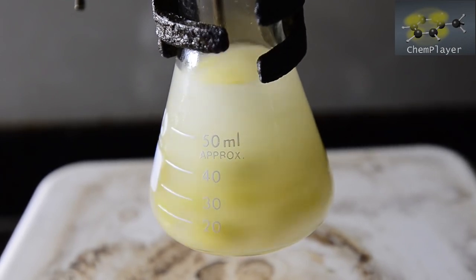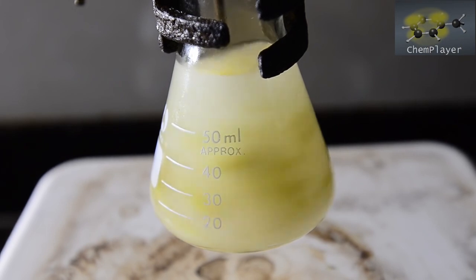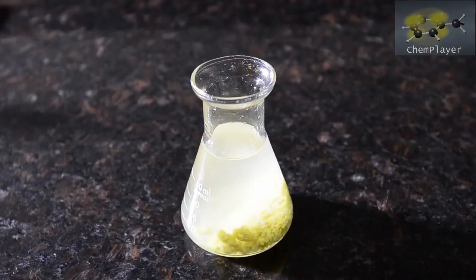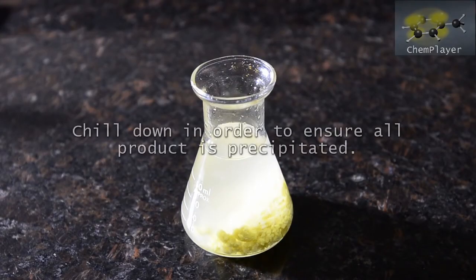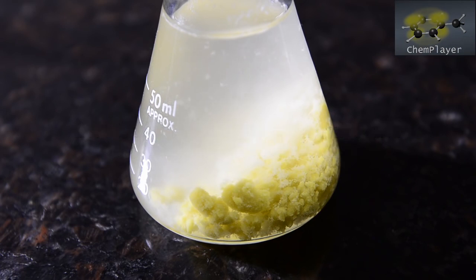You can see some yellow-colored lumps floating around in the mixture. We're going to leave this to chill down now in order to make sure that all our product is precipitated. It seems to be present in the bottom of the flask in quite large solid lumps, so we used a spatula to break this up a bit, ready for filtering.